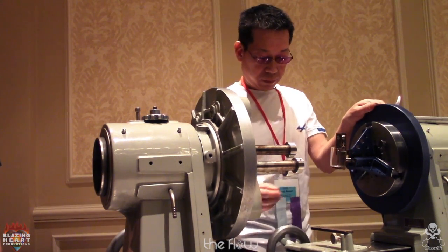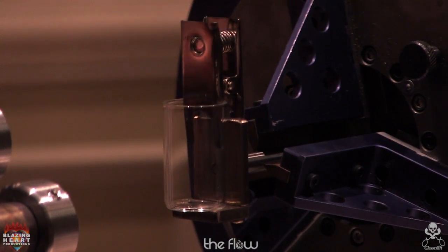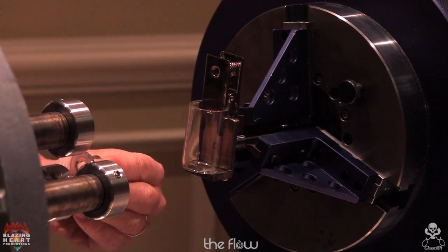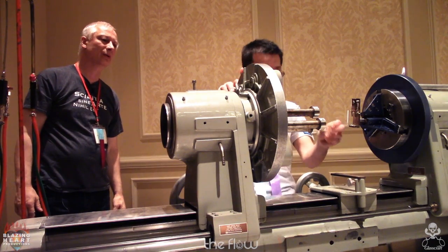So with clean straight chucks, there's no wrap, right? And you get a nice sharp 90-degree corner. So now he's going to load the flange in, pushing it up against the back of the shoulder, that little step. And that's also critical.